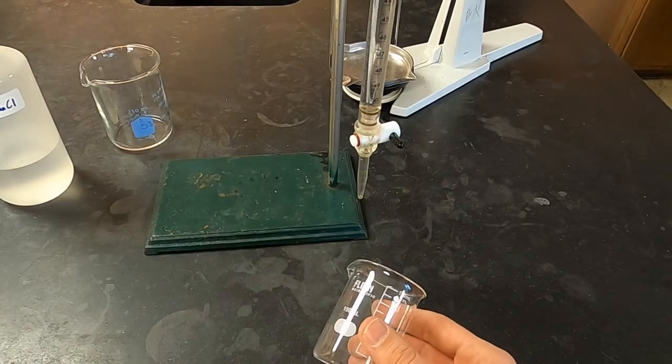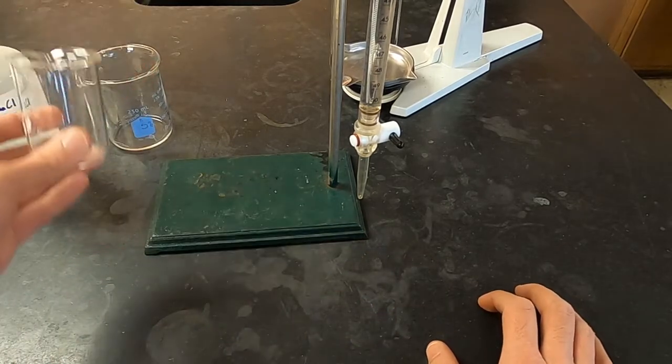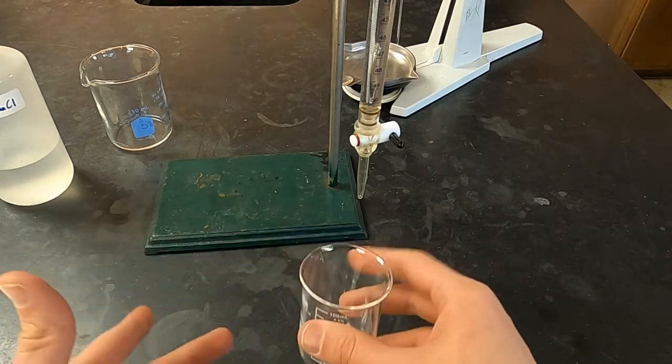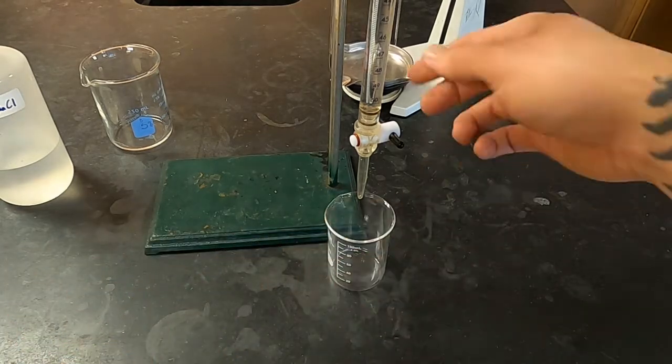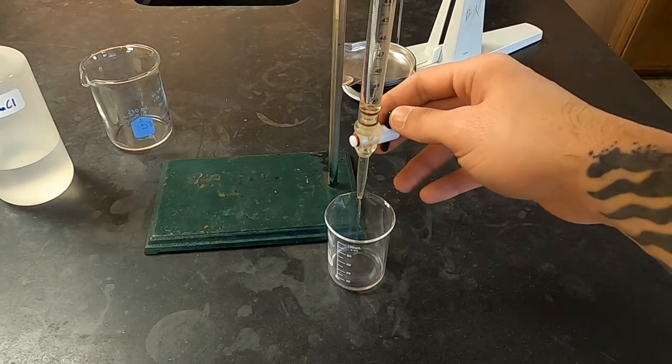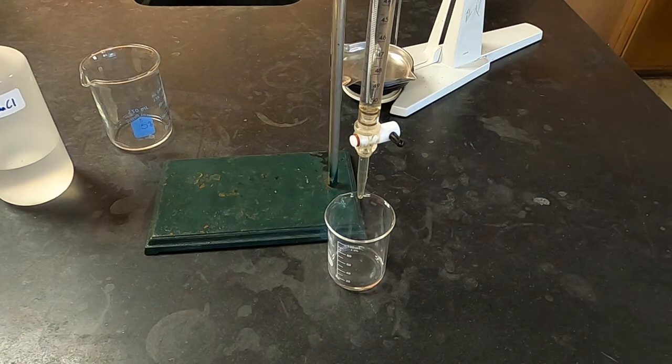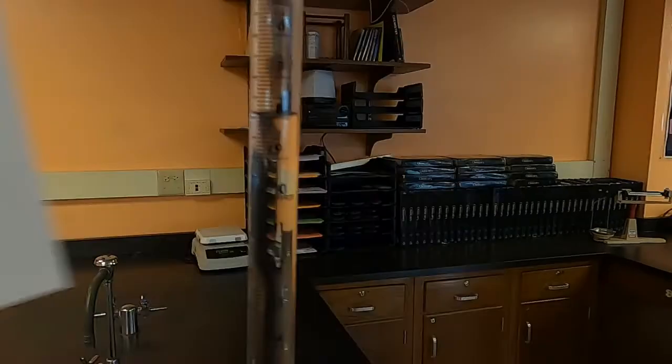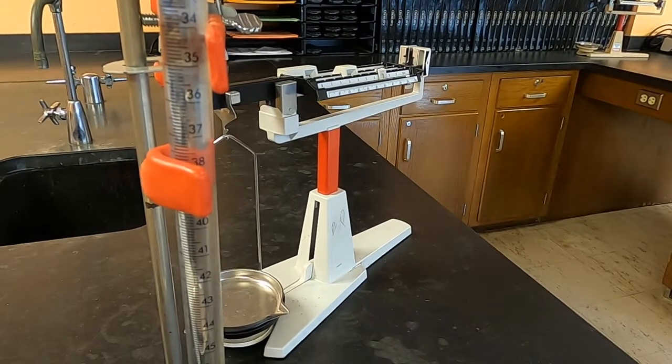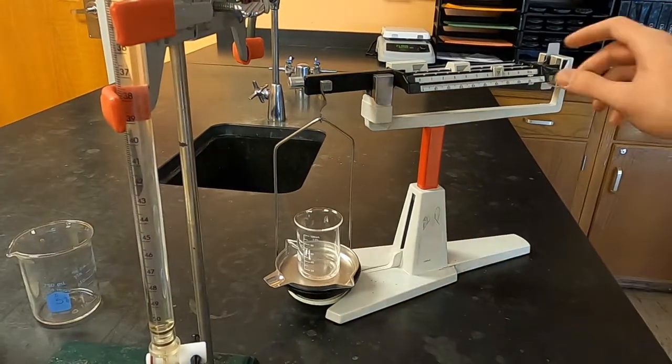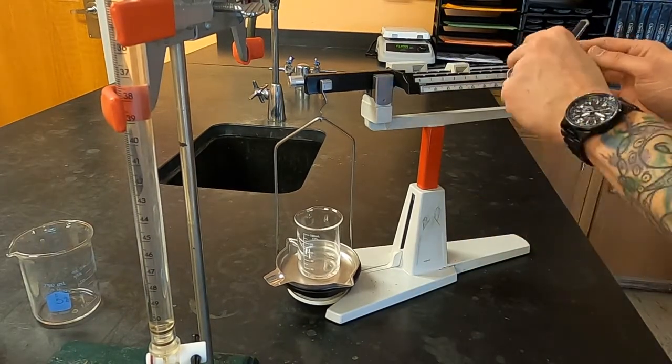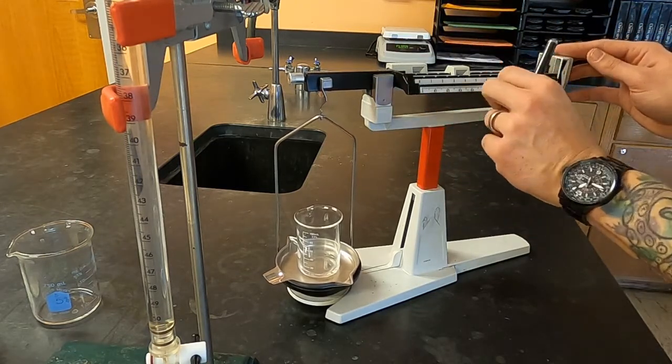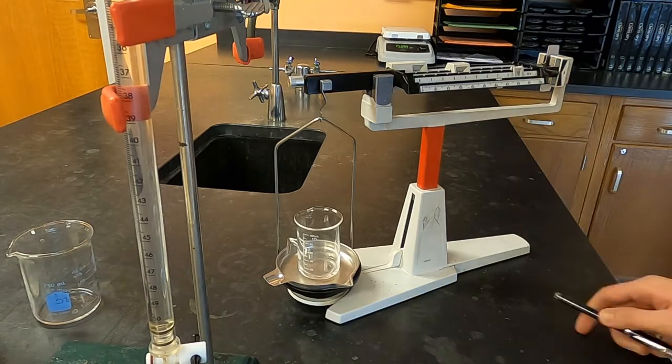Now make sure that between trials you pour out the salt water that was there. You can rinse this out if you choose to but I don't think it will be necessary. But make sure that it is thoroughly dry.